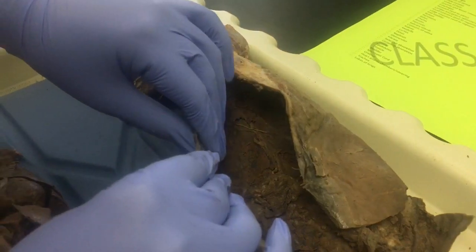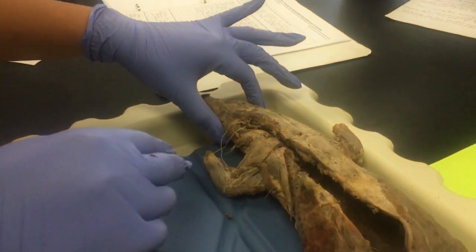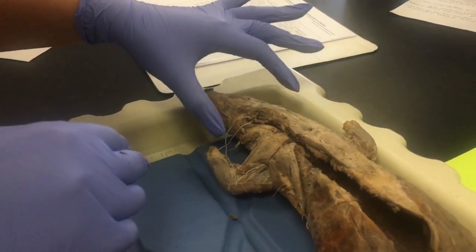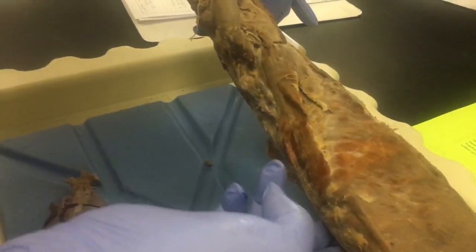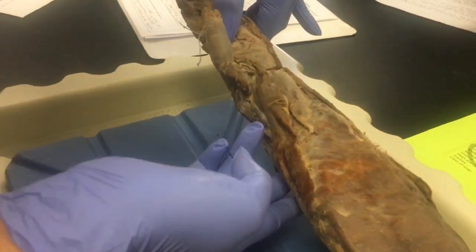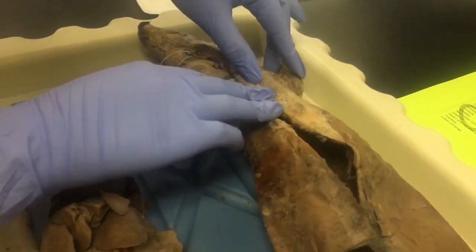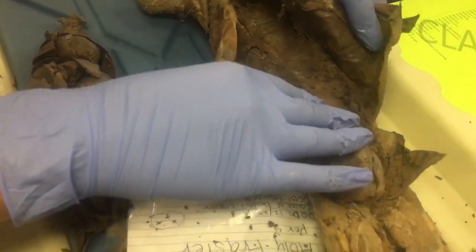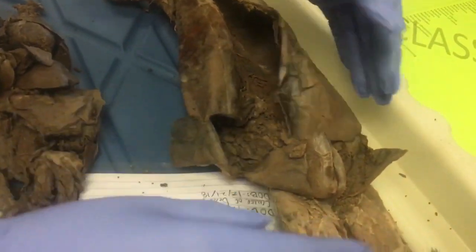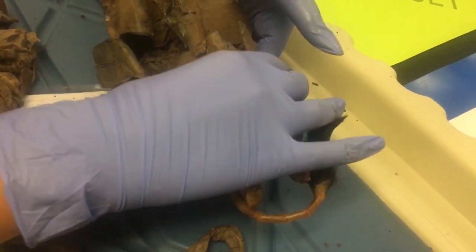Next, I will be talking about the body cavities. We have 5 of them. First, there is the cranial cavity, which has the brain inside of it. Then we have the dorsal body cavity that encloses the brain and the spinal cord. The thoracic cavity encloses the heart and the lungs up here, and the abdominal cavity encloses most of the digestive organs and kidneys, and the pelvic cavity is down here, and that encloses the bladder and reproductive organs.